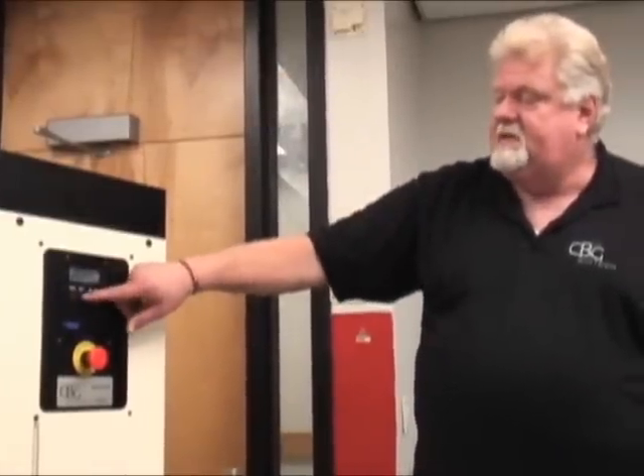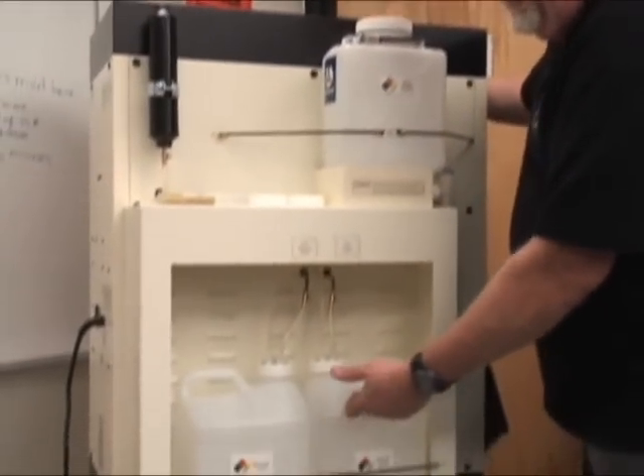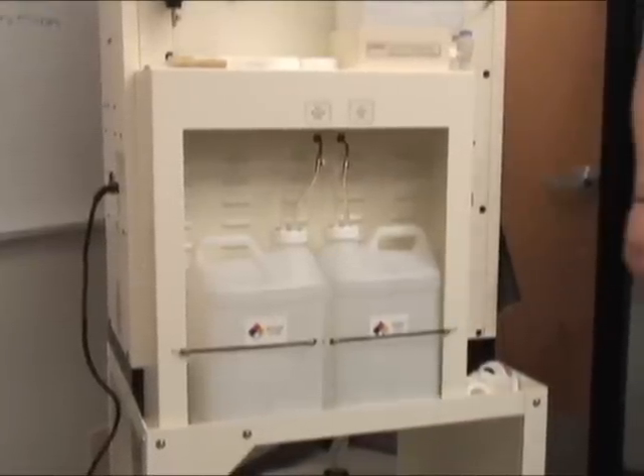It says unit filling. All by itself it will start, operate, and give you an operation time. Xylene is an hour per gallon — a full run takes about two and a half hours. You can run this machine back to back with no cool down time. First, it draws the alcohol waste — the water and alcohol in your xylene, your primary contaminant. Out of a full run you'll get a half a liter or less of liquid waste.